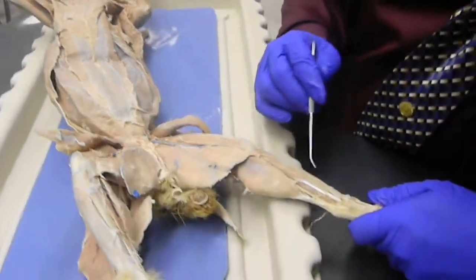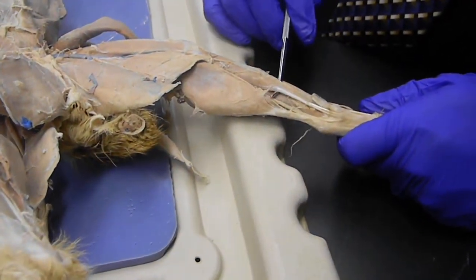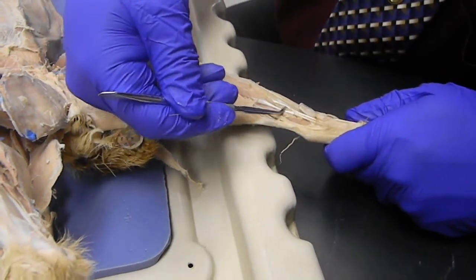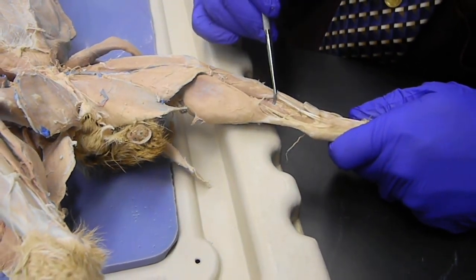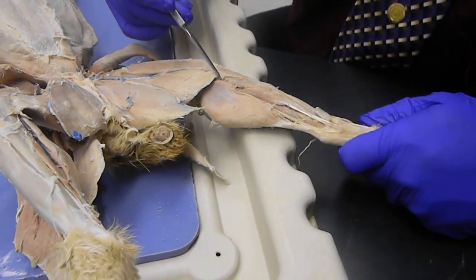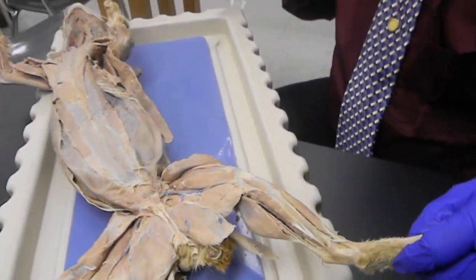On the inside of the leg, again, we're going to pick them up by tendons. The one that's on top here is the flexor digitorum longus. The next tendon down, which we're only going to see the tendon, the muscle's way up underneath, that's the tibialis posterior, and the big muscle in the background is the flexor hallucis longus. And the one that wraps around the back of the knee right here, this one that comes from the front all the way to the side, is the popliteus. Should be it.